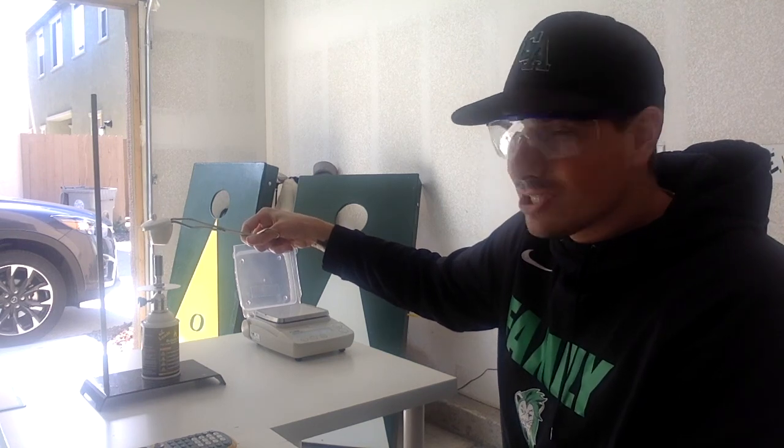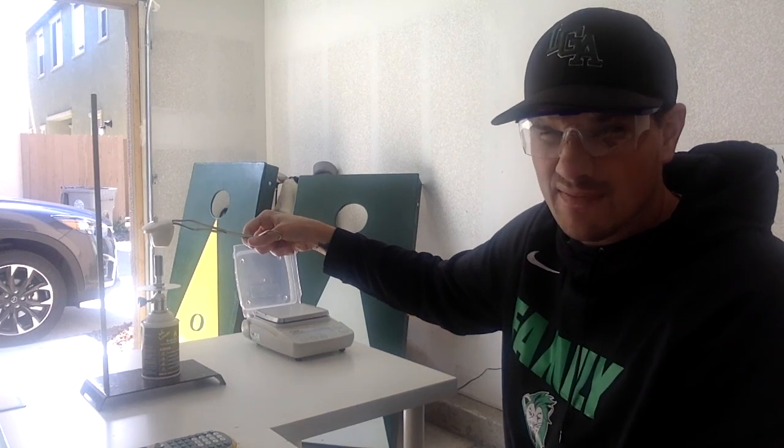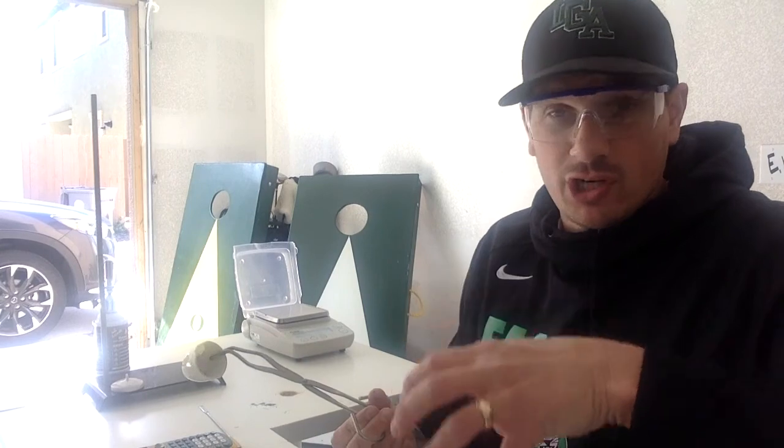So this reaction usually takes a couple minutes. So I'm going to pause now, and then we'll come back when the stuff actually burns. So literally, right after I shut that off, it actually started to burn, and it was really, really bright, and the crucible started to crack, so I freaked out a little bit, so I'm glad I stopped it.